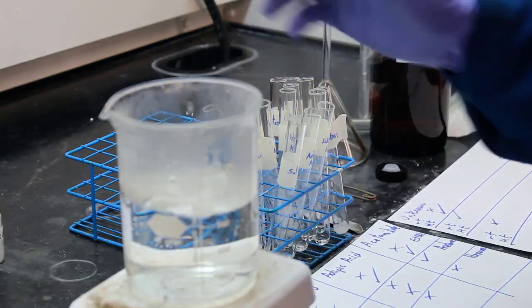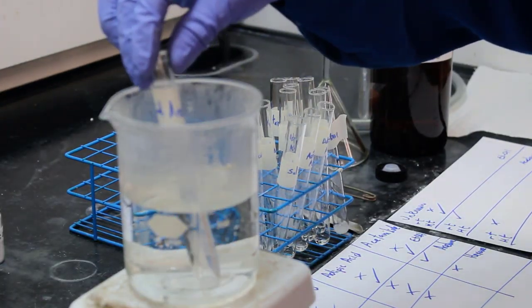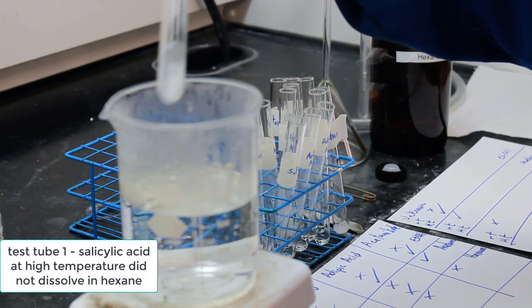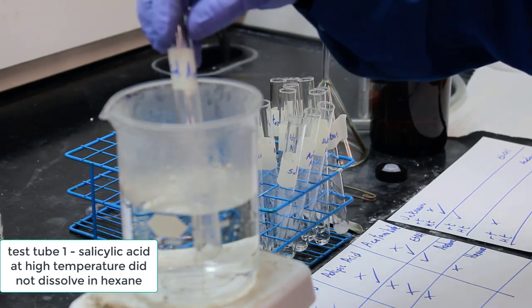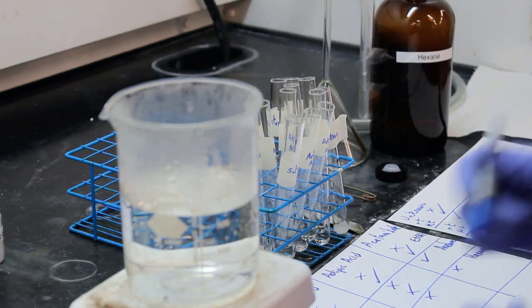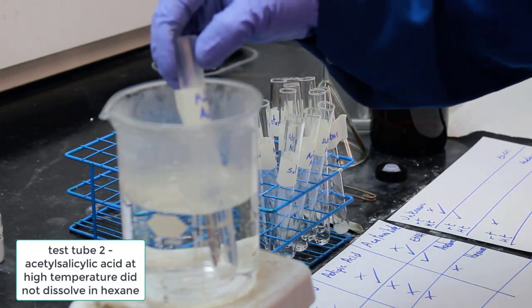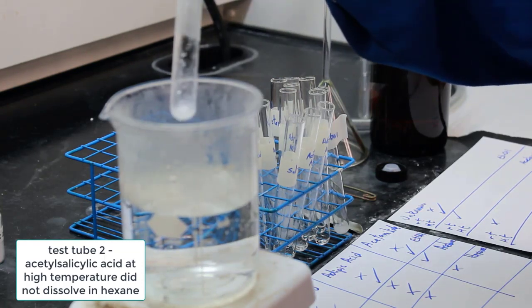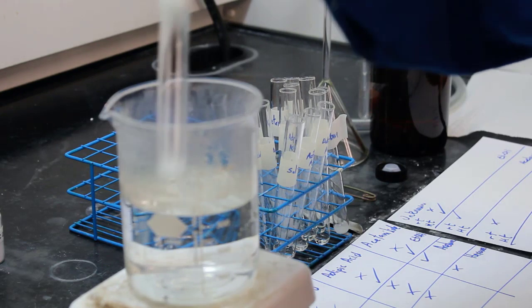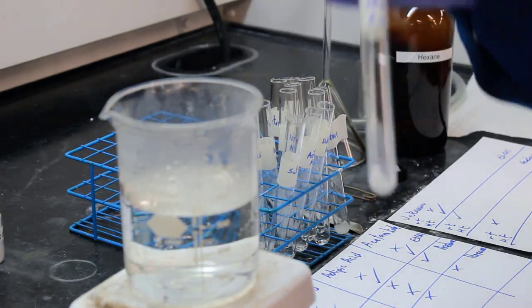So none of them dissolved at room temperature. So put all 5 in the hot water. 5 of them go in the hot water. All right, salicylic acid is not dissolving at high temperature in hexane, so it gets an X. Acetylsalicylic acid at high temperature is also not dissolving when it's in hexane. All right, so hexane is definitely a horrible recrystallization solvent for those two.